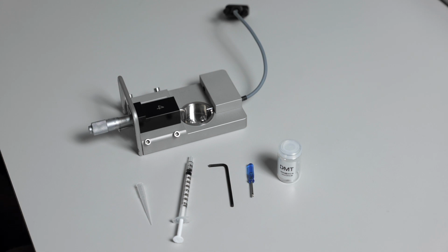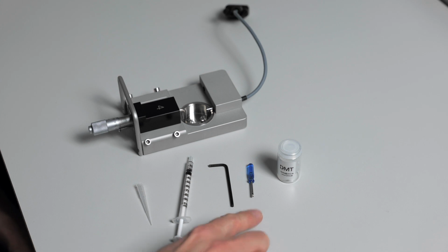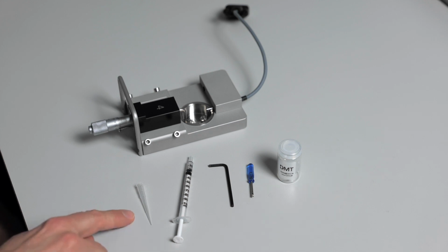To do this, you will need the silicone grease that came with your system, as well as the small screwdriver, the Allen key for removing the transducer housing, a 1 ml syringe, and a pipette tip. These will be used to apply the new grease.